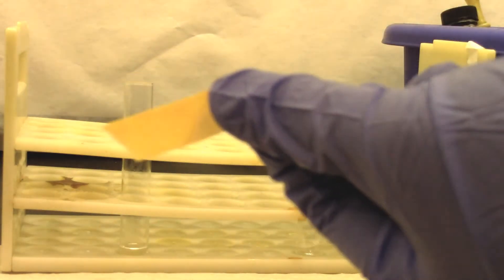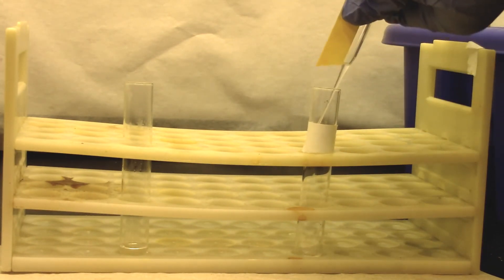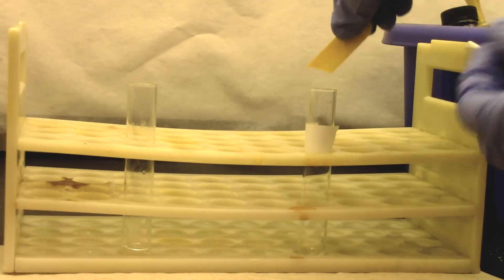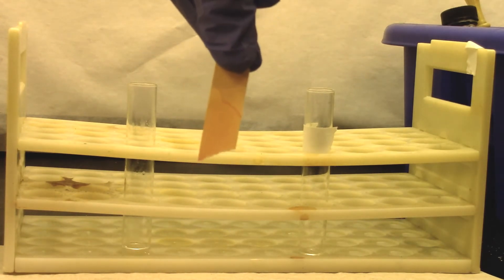Let's look at the aniline dye. This one has no reaction.